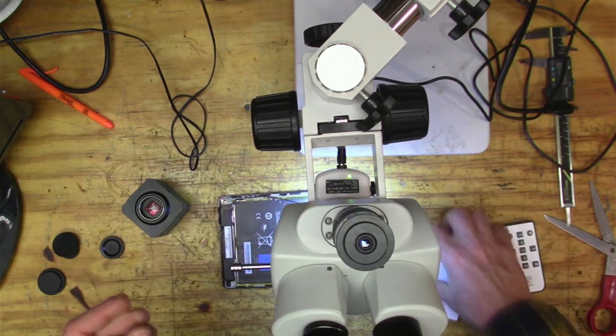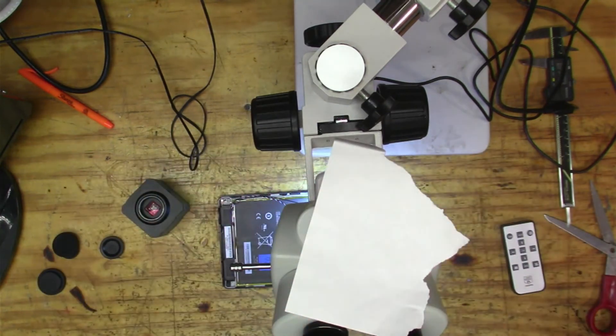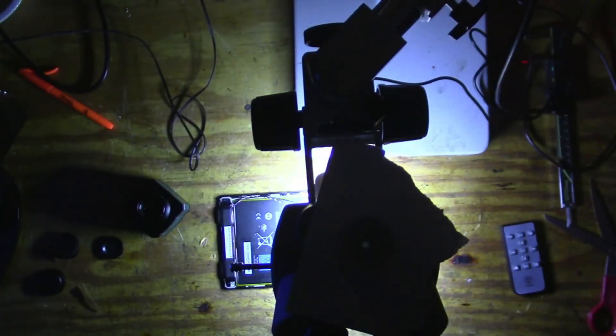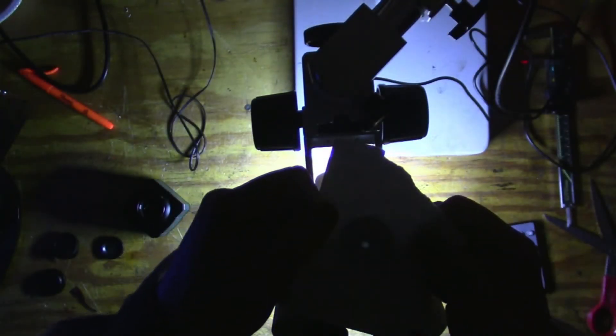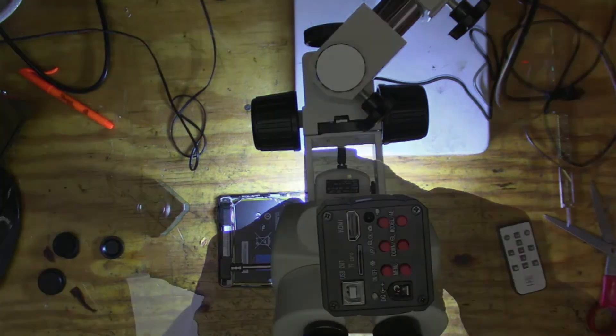And I think so, if you take a piece of paper here, I'm just going to shut the lights off. And if I lift the paper to about where the imager would be, you see that it is about the right size. Maybe you can't see that, but it's about the right size for that imager, right?